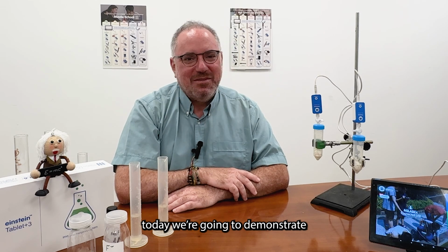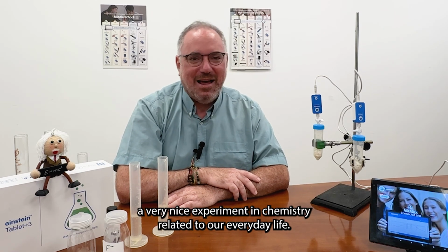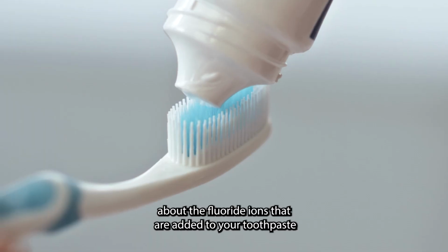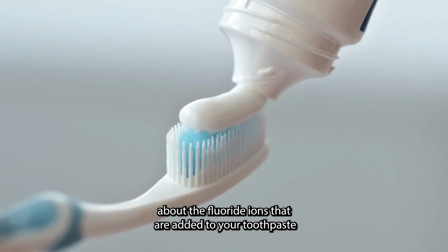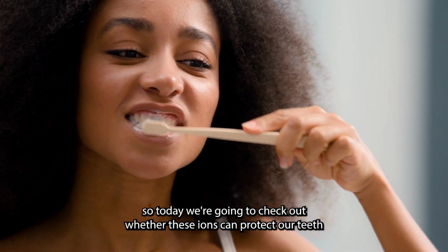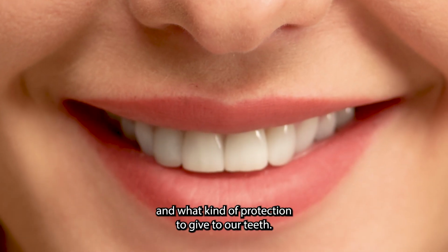Today we're gonna demonstrate a very nice experiment in chemistry related to our everyday life. I don't know if you ever thought when you're brushing your teeth about the fluoride ions that are added to your toothpaste. So today we're gonna check out whether these ions can protect our teeth and what kind of protection they give to our teeth.